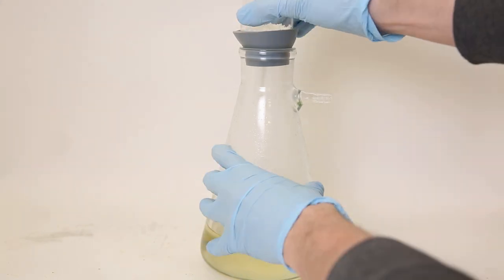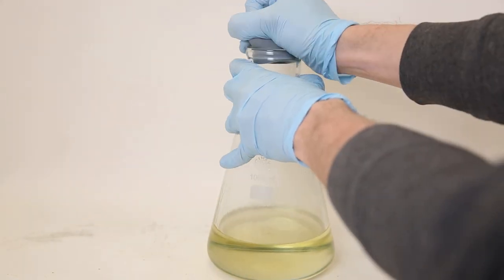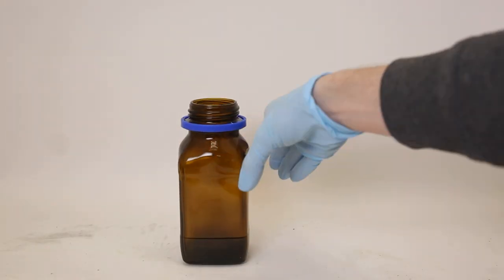After everything has filtered through, we are left with a clear, slightly yellow liquid, which I transferred to its own container.